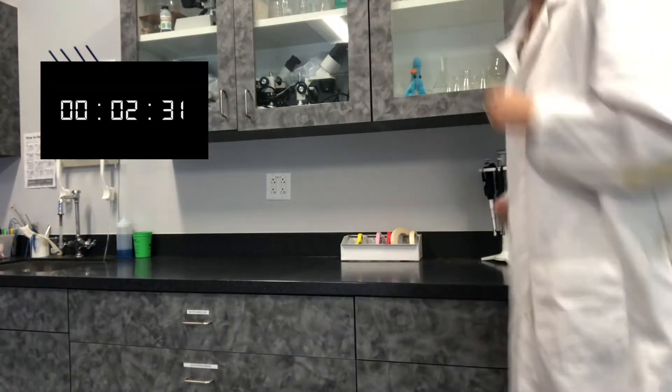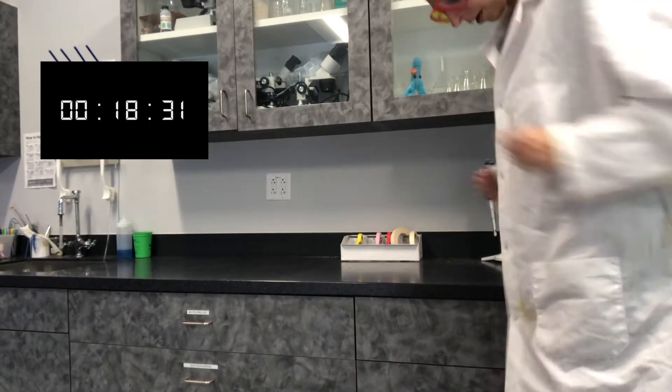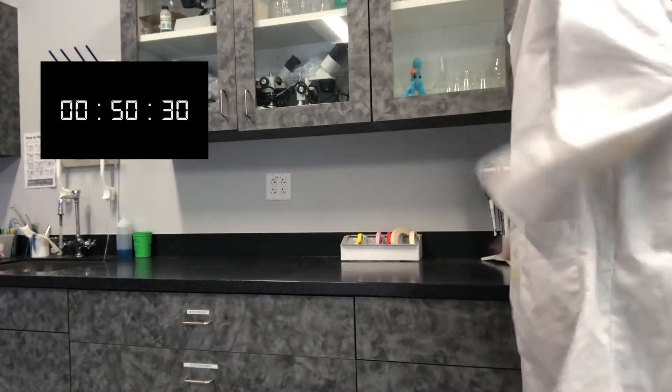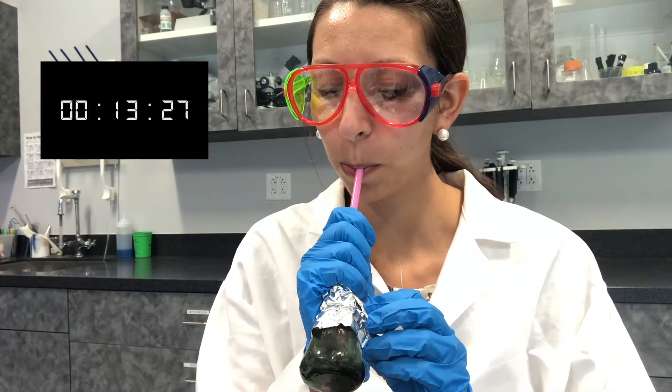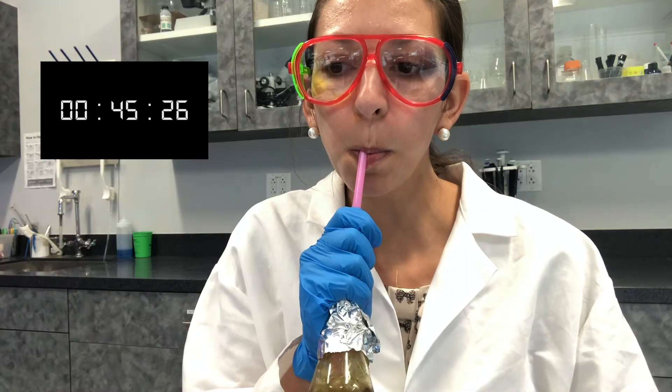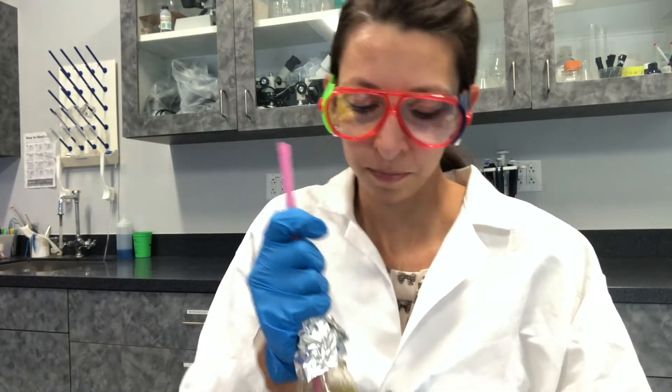I have a new piece of foil and a new straw ready to go, and I'm going to set the timer for one minute while I jog in place. All right, that's time. You want to quickly get your experiment set up again. If you're doing this in a group it's good to have someone get the materials ready as quickly as possible. I'm going to get my new straw and foil and set my timer again for one minute. Remember, do not inhale — just exhale.